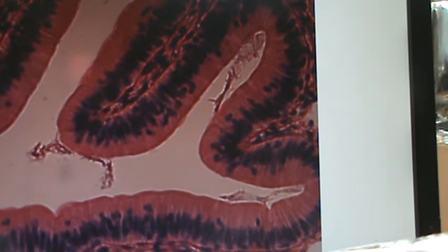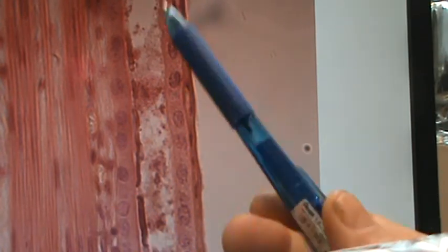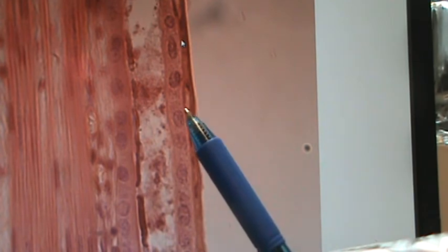Okay, let's go on to another picture of it. And over here on the side. Now notice the shapes of the cells are different here. This is not columnar or squamous. This is cuboidal, believe it or not, because they're sort of squarish cells. See that going along here? So you see nucleus, nucleus, nucleus, nucleus, and the actual cell would be like this. Let me use my, so you can see. So maybe better to zoom. Just a second.